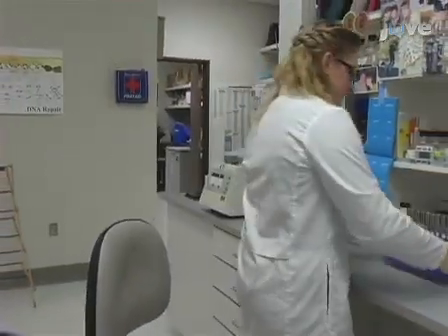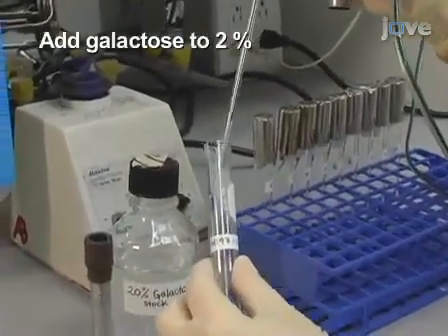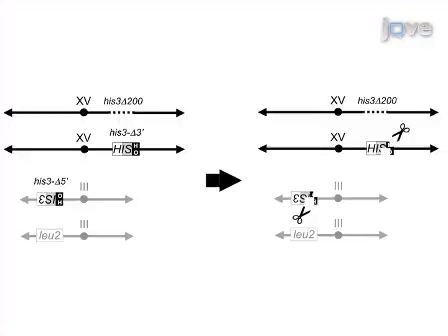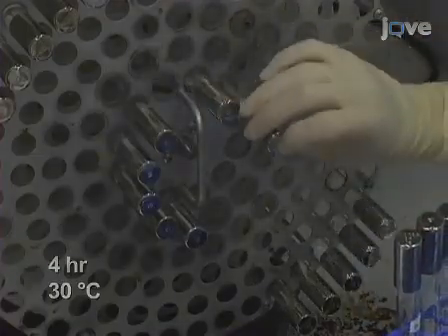When the cultures have reached the desired cell density, add 20% galactose to the cultures to a final concentration of 2%. The galactose will induce expression of the HO-endonuclease, which will direct double-strand breaks at the his3 delta 5' allele on chromosome 3 and his3 delta 3' allele on chromosome 15. Incubate for 4 hours at 30 degrees Celsius on a rotator.